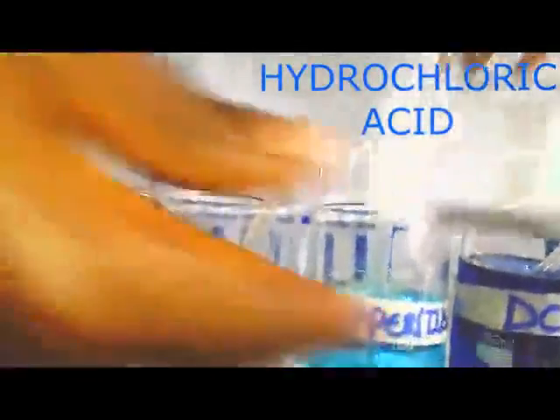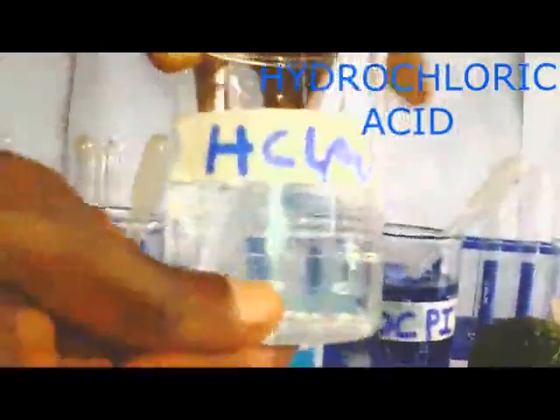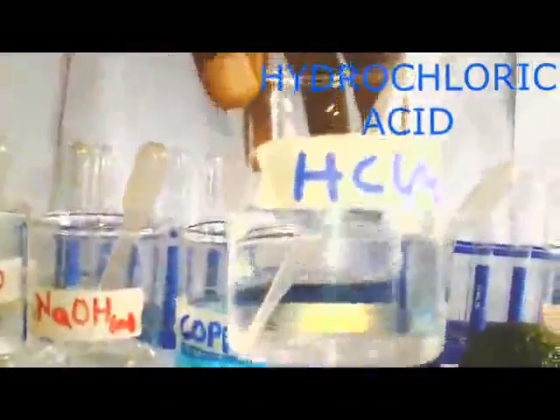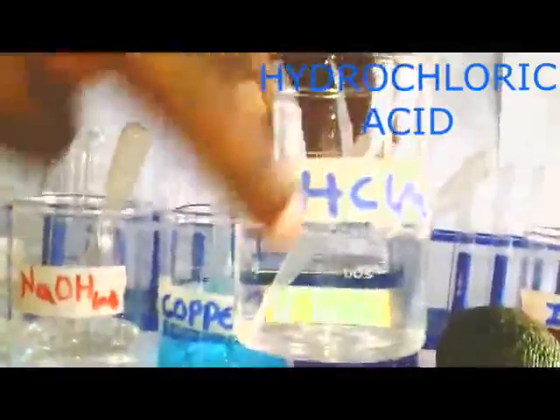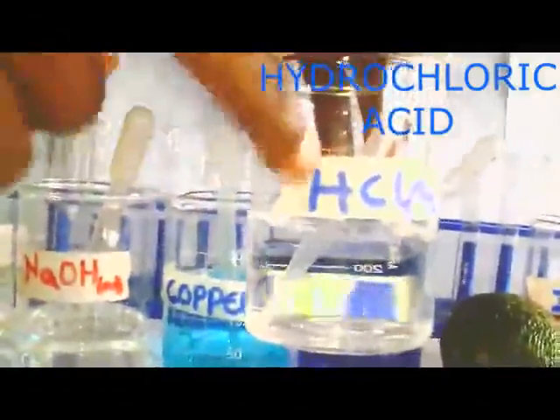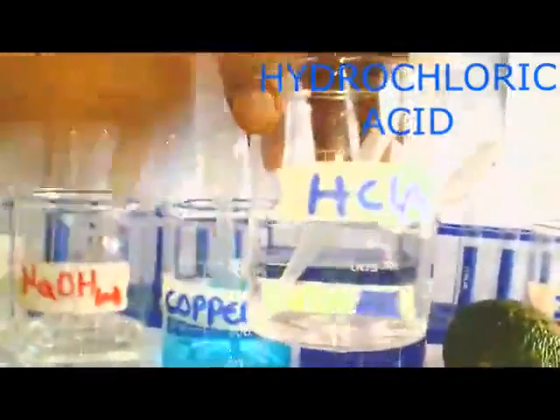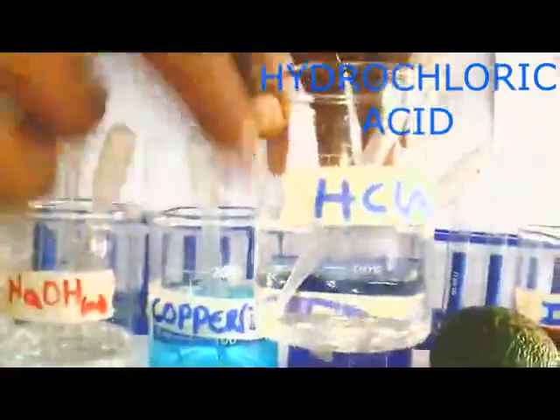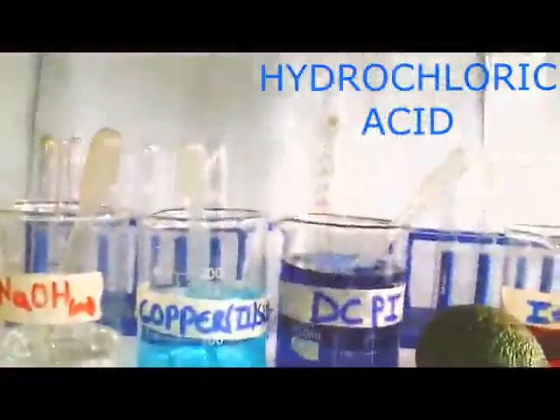It is appearing colorless. This one is hydrochloric acid, or HCl. We are going to use it when carrying out the non-reducing sugar test. Don't forget that. It is very important because it helps us to do what we call hydrolysis, or breakdown, of non-reducing sugar, as we are going to see as we move ahead.